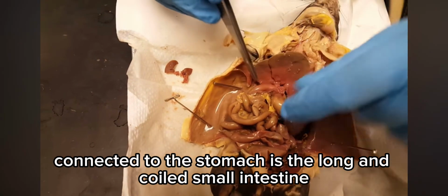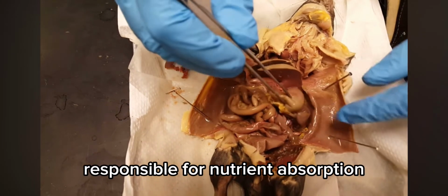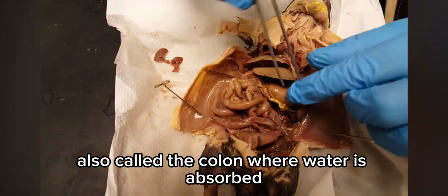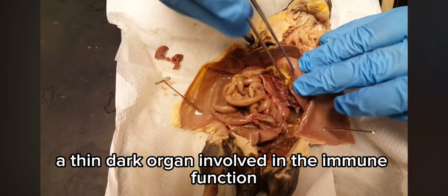Connected to the stomach is the long coiled small intestine, responsible for nutrient absorption. Below the small intestine lies the large intestine, also called the colon, where water is absorbed. You may also see the spleen, a thin dark organ involved in immune function.